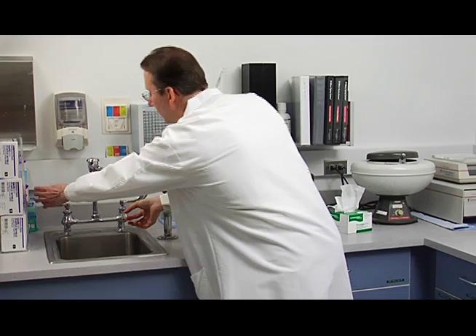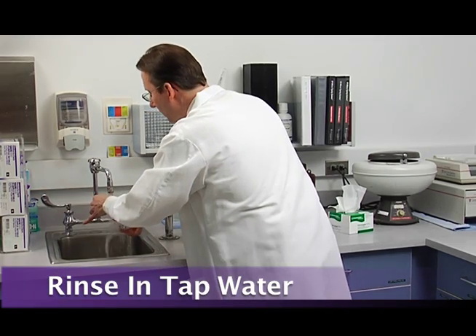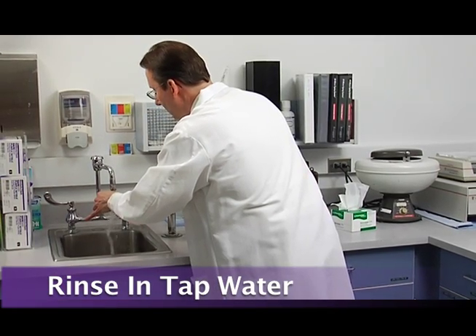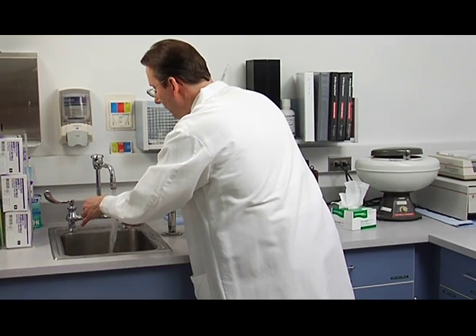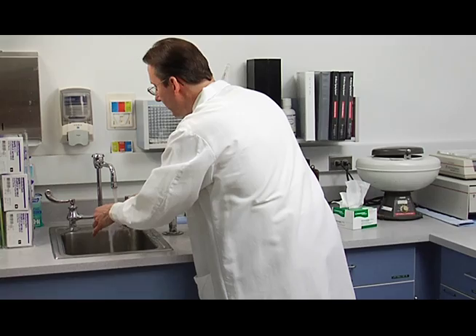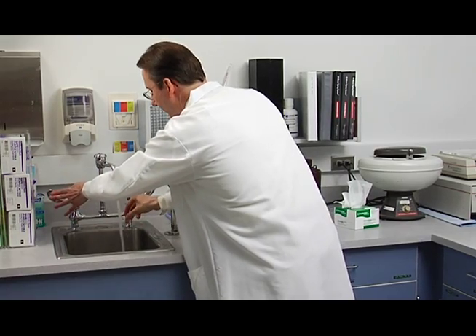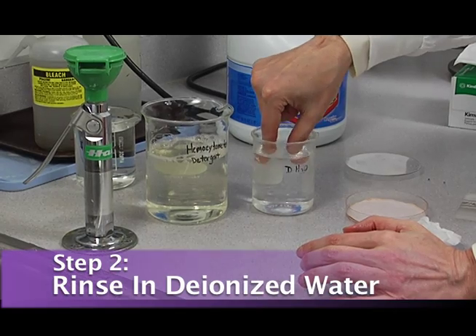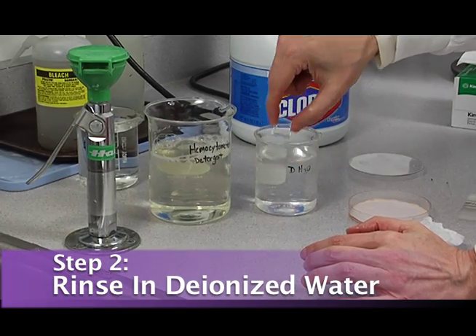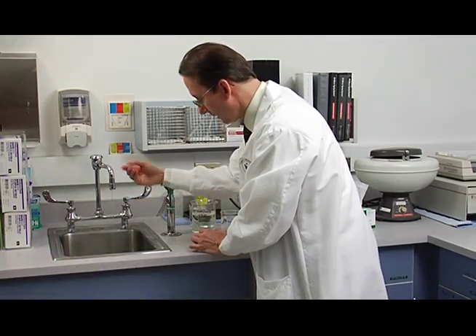Now we're going to rinse it in warm tap water. We'll rinse it thoroughly in tap water. Shake off the excess water and then rinse it in deionized water here. And you can shake off the excess here.